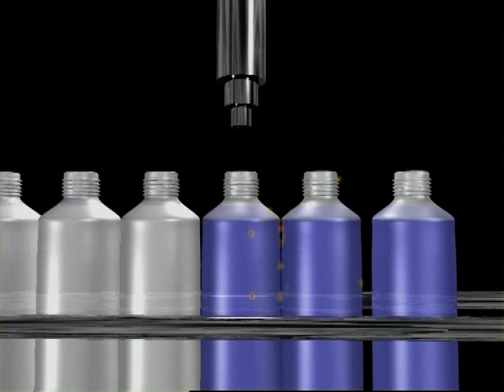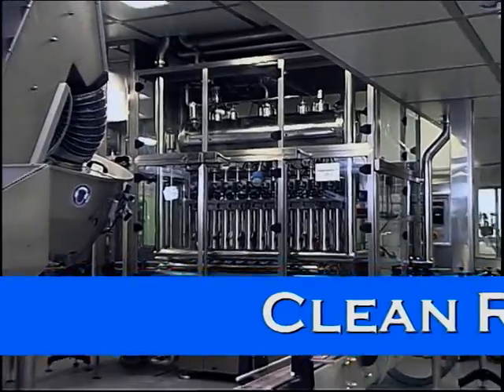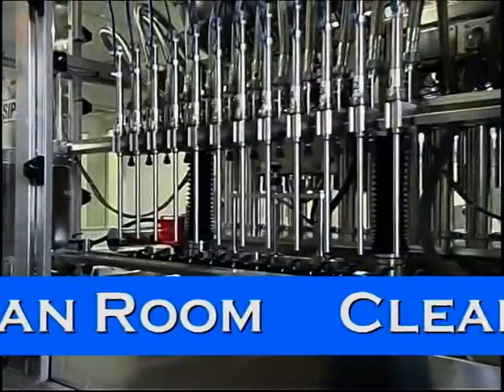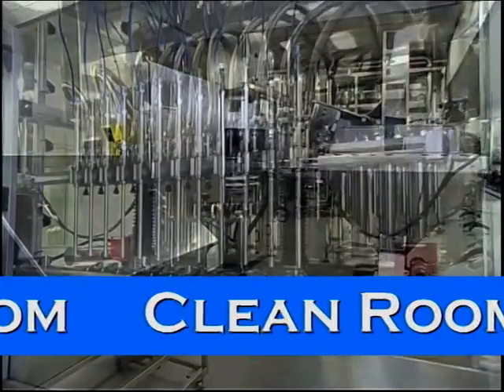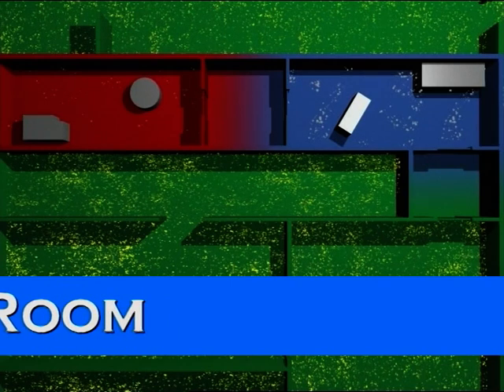To prevent this, clean rooms are separated from the other rooms by airlocks. And of course, they are equipped with special ventilation and extraction systems. Let's look at a diagram of all this. Then you can see clearly the rooms with the airlocks and the various microorganisms inside and out. But what is a lot and how much is not many?